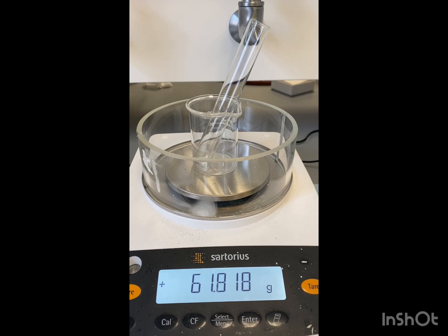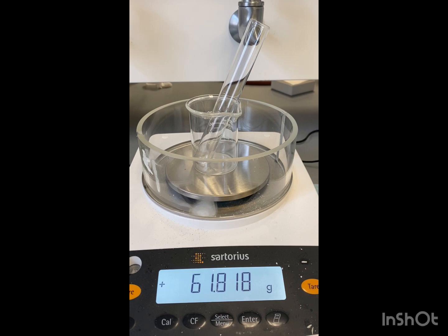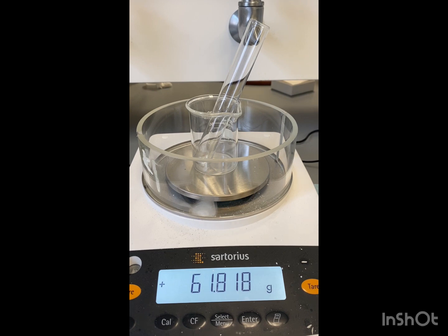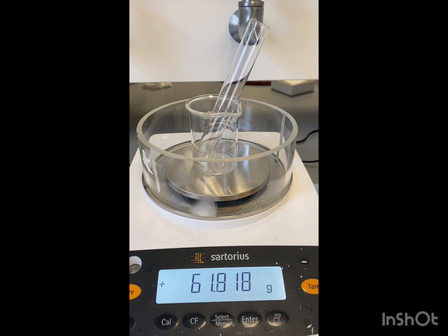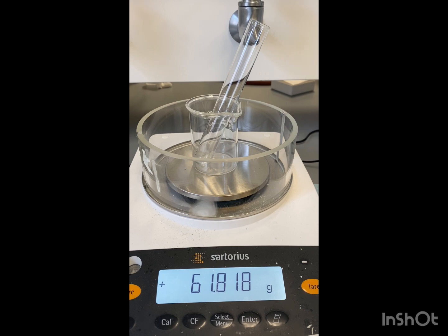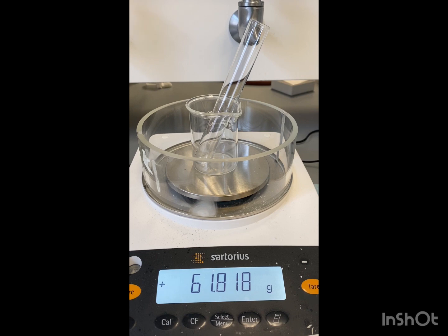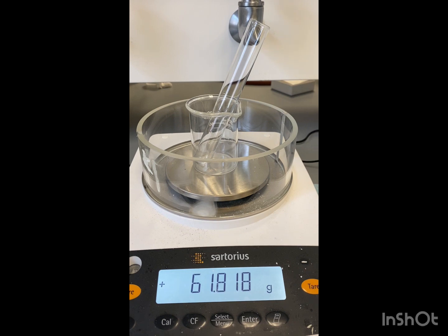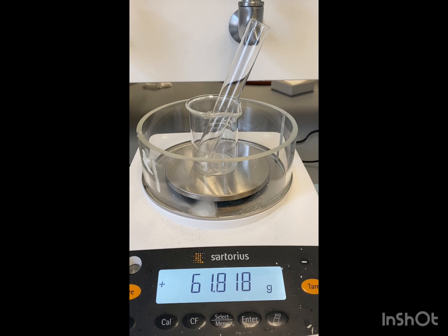Now that we've done our calculations, we're going to go ahead and mix. I'm going to use methyl pyruvate, so this will be for methyl pyruvate. You do the same exact thing if you're using ethyl — it's just a different molar mass, so the amounts will be different. The workup procedure is the same for both methyl and ethyl; it's just a different molar mass, so your calculations will be a little different. For methyl pyruvate, we want around 102 milligrams.